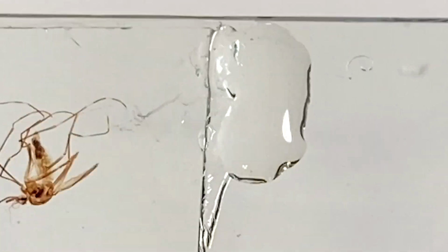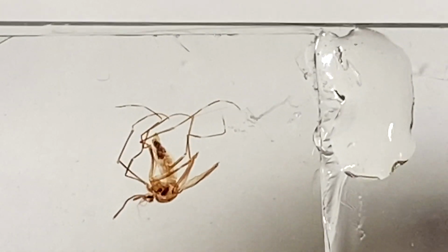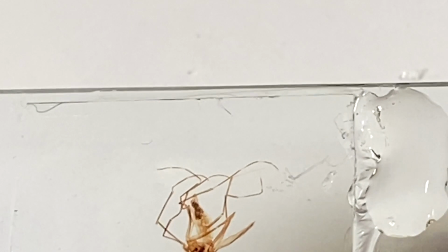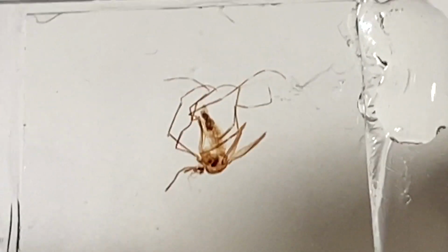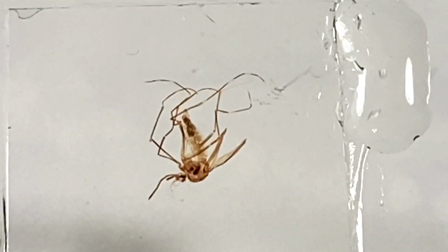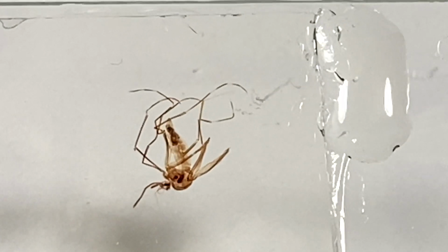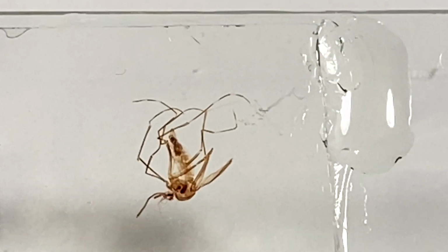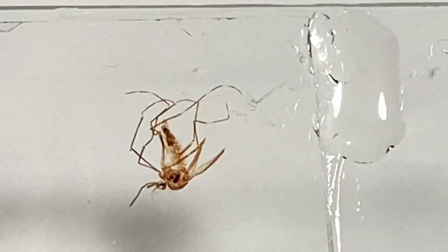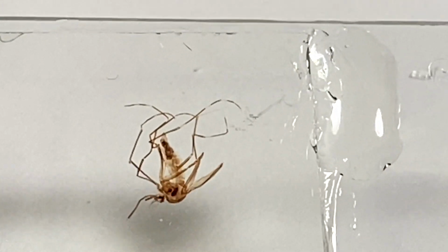If you have a very small bubble on the outside, and it doesn't seem to bother you, and it's not noticeable under low magnification, that's up to you whether you want to try it or not. But the individual that told me about this, her name was Levinson. So I'm going to call this the Levinson method. She's an arts and crafts person that uses resins. And she learned that heating up whatever it was she was working on, if there was a bubble in there, with a hairdryer would cause the bubbles to rise to the top.